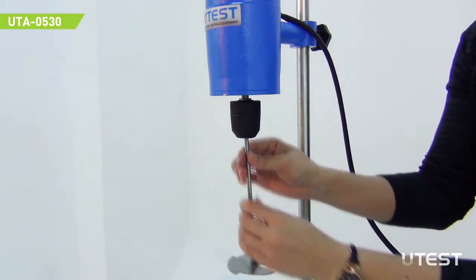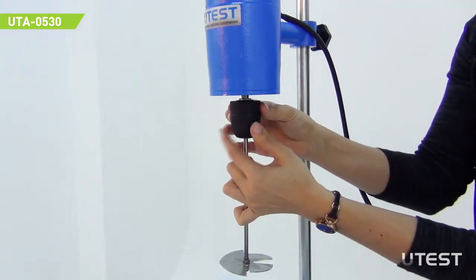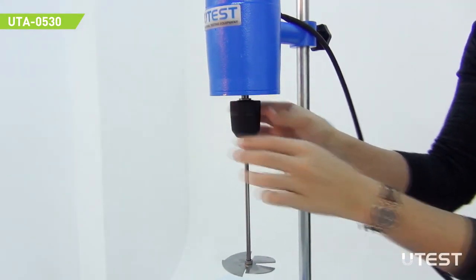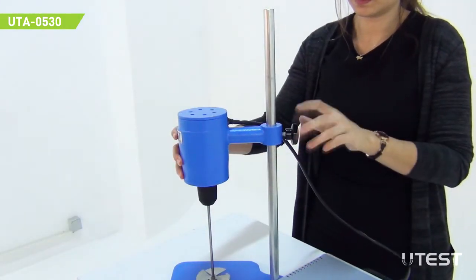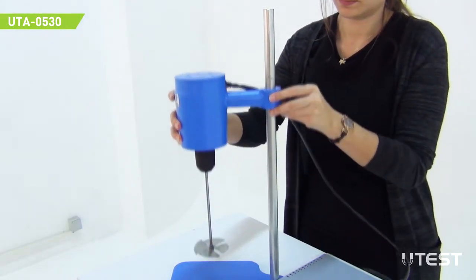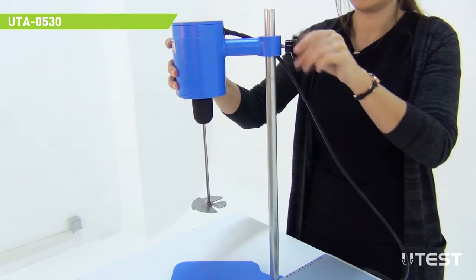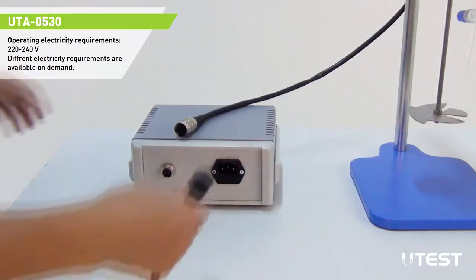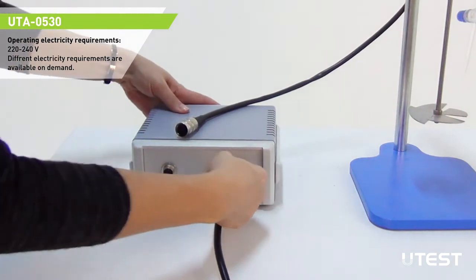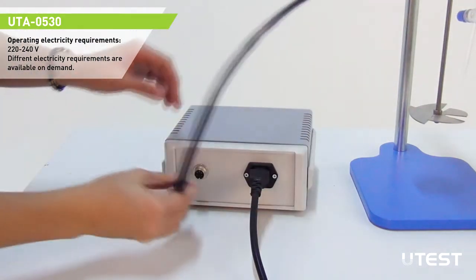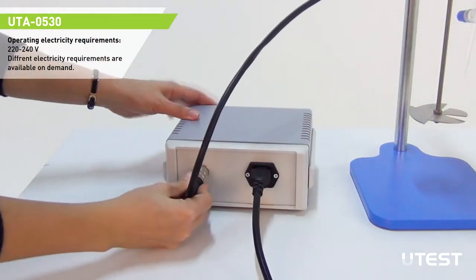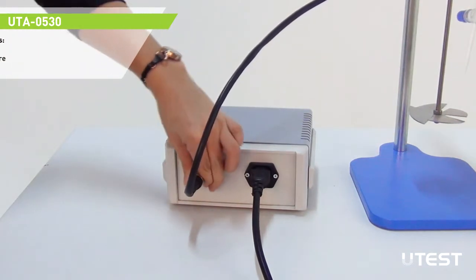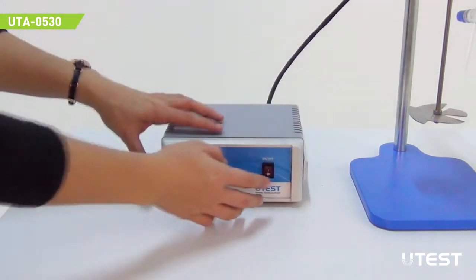Connect the rotating shaft to the stirrer. Loosen the nut, arrange the stirrer height and squeeze back the nut. Plug the power cable and 5-pin connector to the control unit and turn on the device.